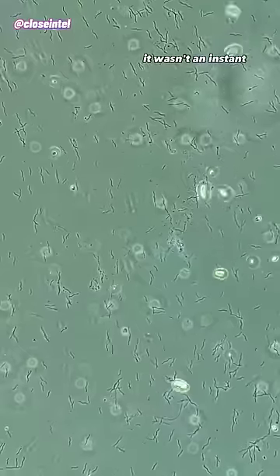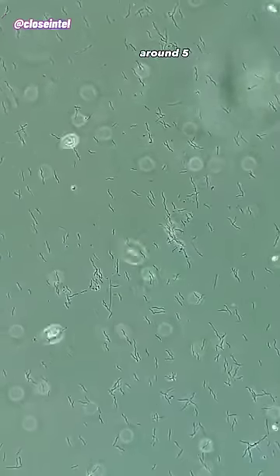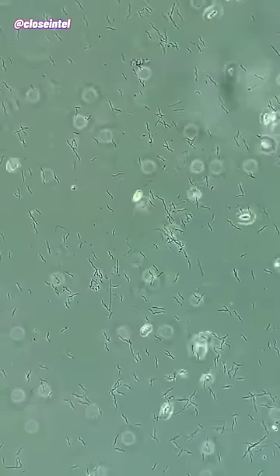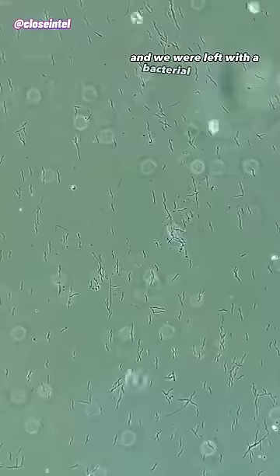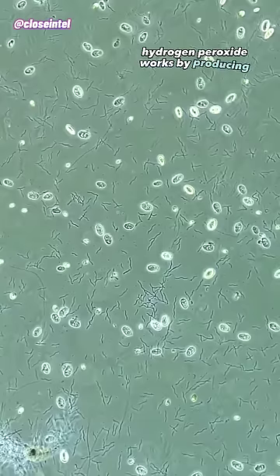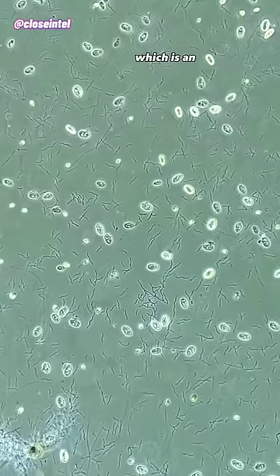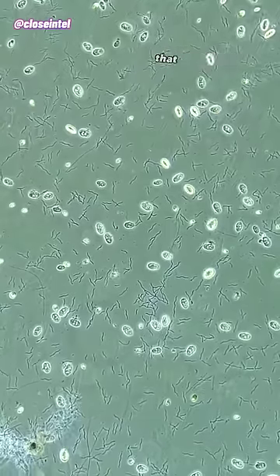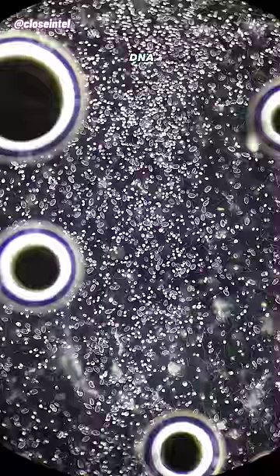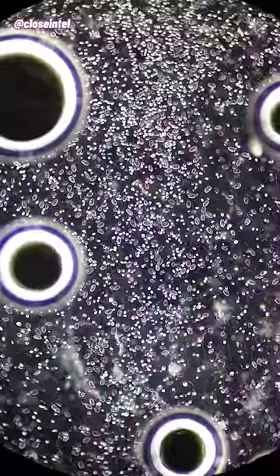It wasn't an instant visual, but the bacteria did stop moving after around 5 minutes of letting it seep into the slide, and we were left with a bacterial graveyard. Hydrogen peroxide works by producing hydroxyl radicals, which is an extremely reactive form of oxygen that can attack membrane lipids, DNA, and other essential cell components that keep them alive.